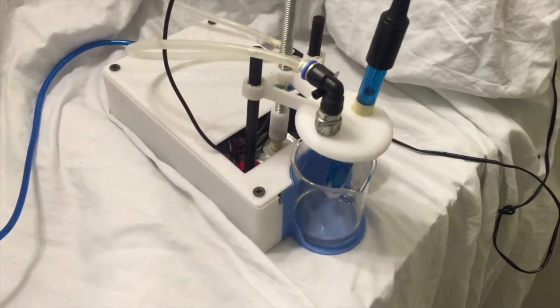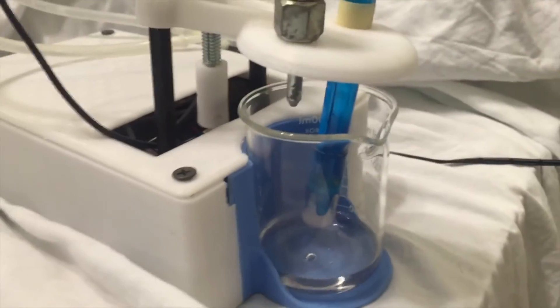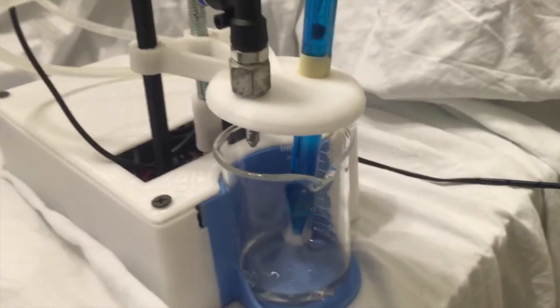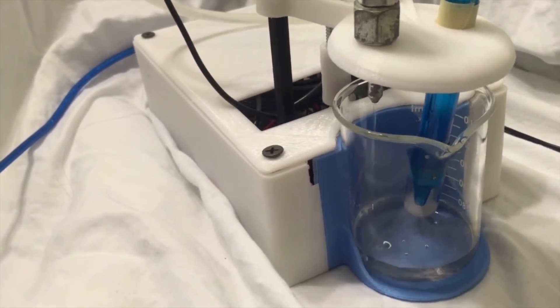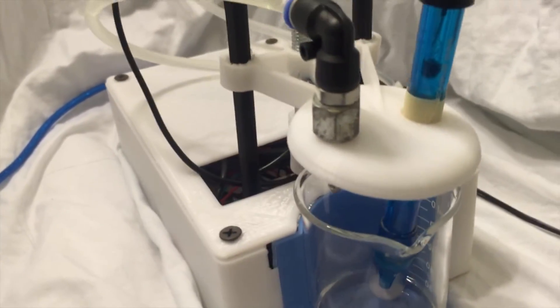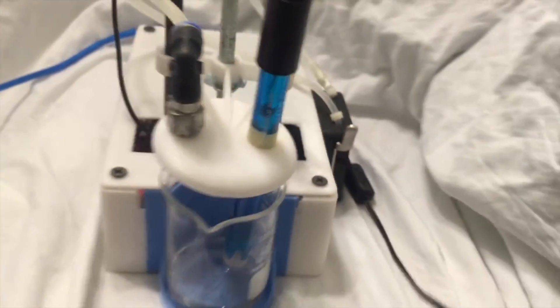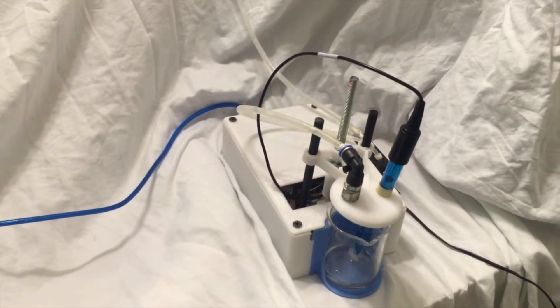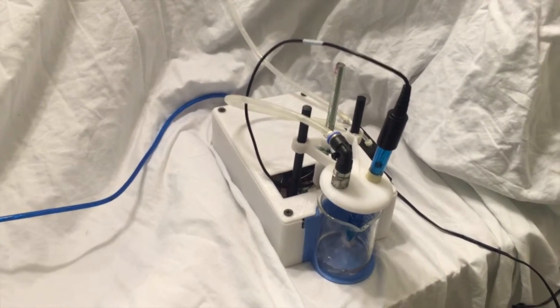You can see the boom is coming down, and then the cycling begins. This is an exact volume, and there's the pump right there running. Once it's complete, the mast will go back up, but that'll take some time so I'll cut the video short.